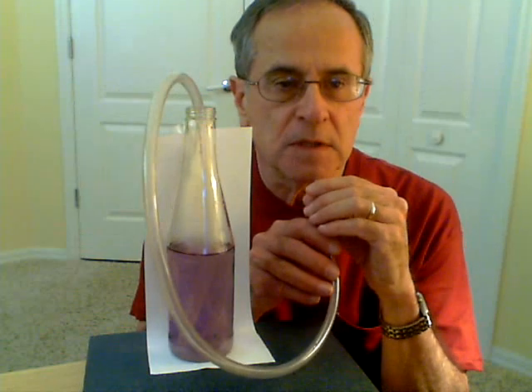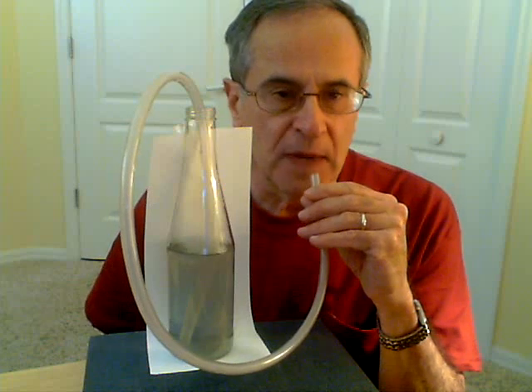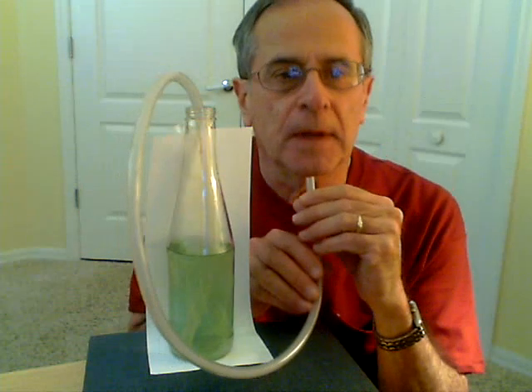Now, because I put a base in there, it will take a little bit of time, but I'm going to blow into the tube into the bottle and we'll see what happens. I do have to neutralize whatever base is in there, so it's probably going to take me a little longer than it would if I didn't make it so basic. You can see that it's a little bit greener. And now it's a yellow color — quite a difference.